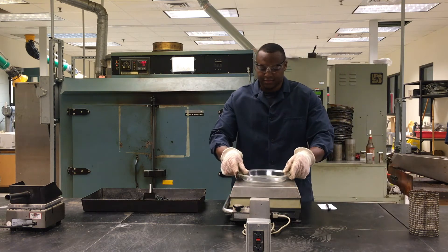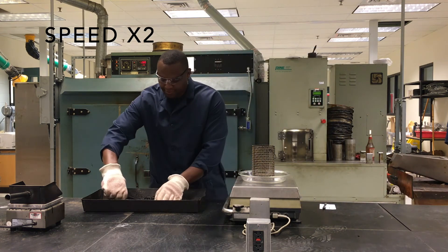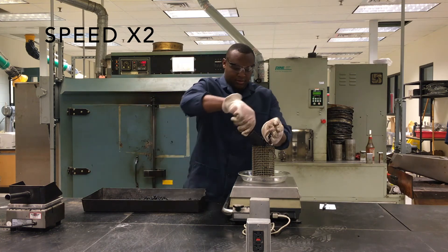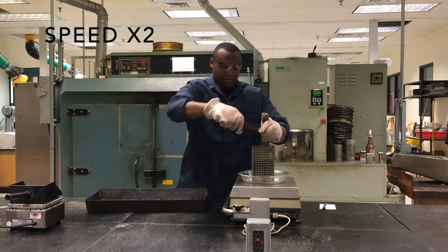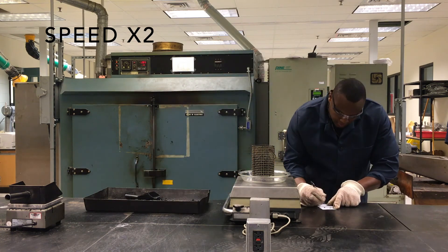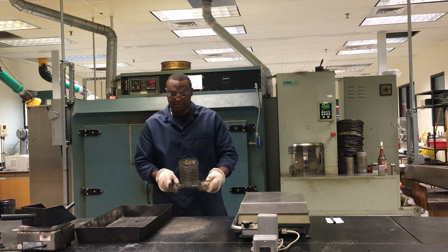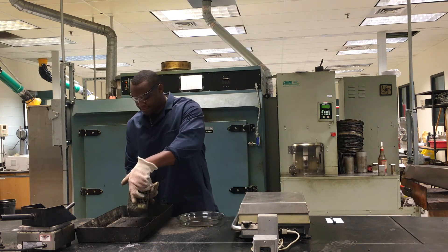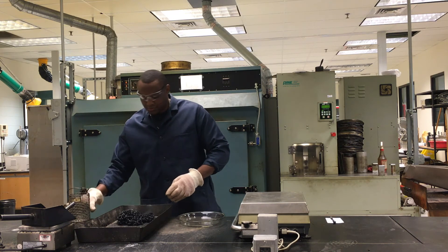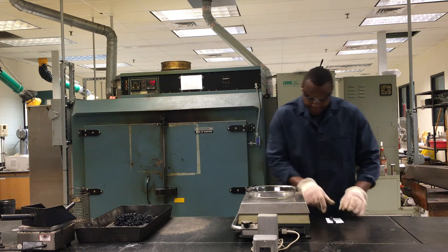Remove the first sample from the oven, then repeat for the second sample. Remove the basket from the plate. Carefully remove any aggregate that may have fallen onto the plate. Weigh the plate and record the weight as PF.